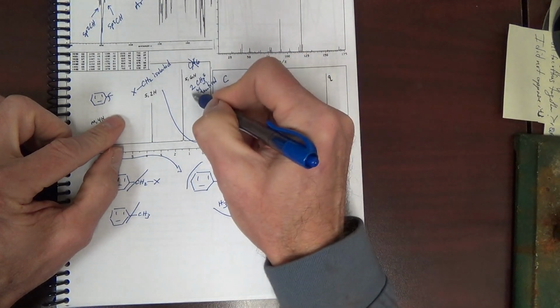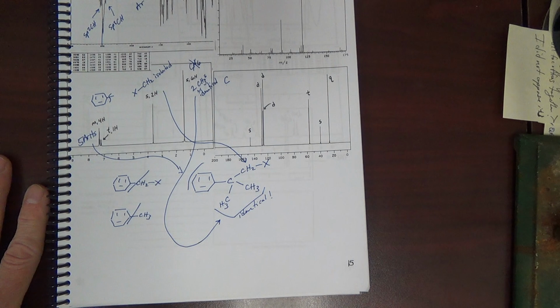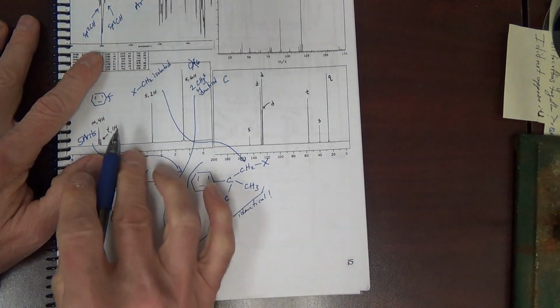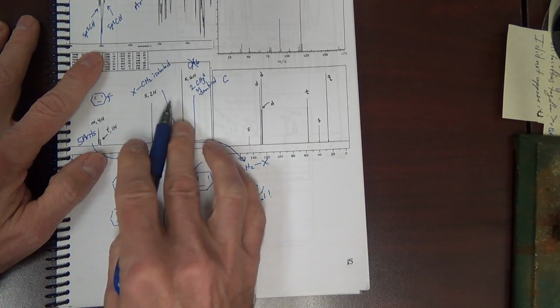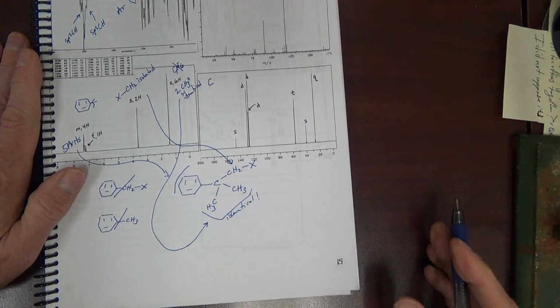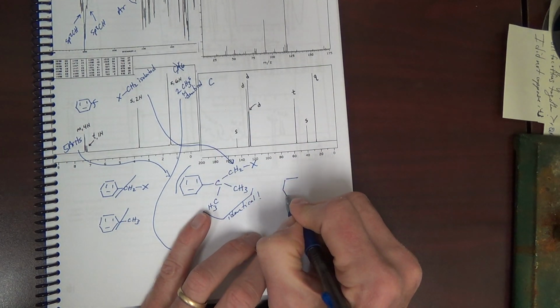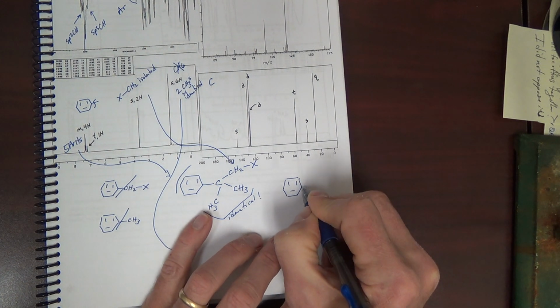And then the two identical methyls here. Again, I was actually able to solve the structure just from proton and IR. Didn't even use carbon NMR. That's just my approach. We need to assign carbon NMR though. I'll do this line bond.